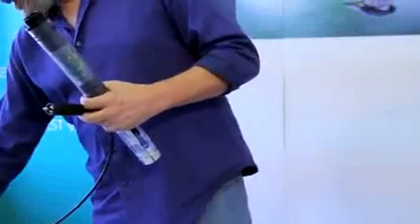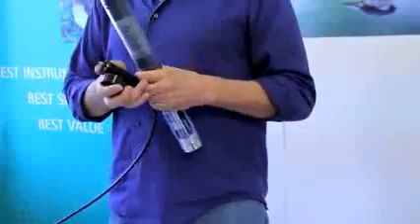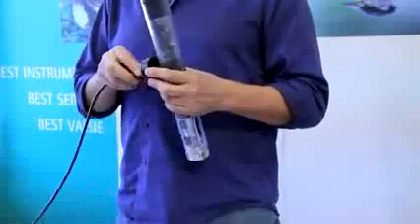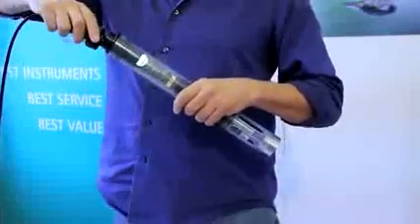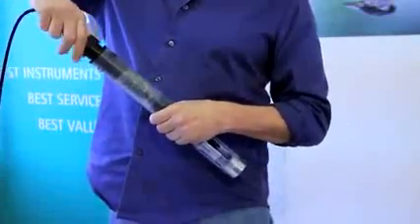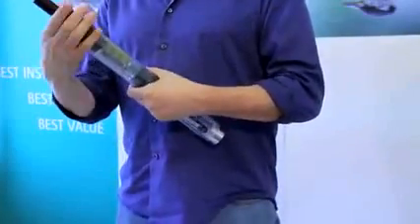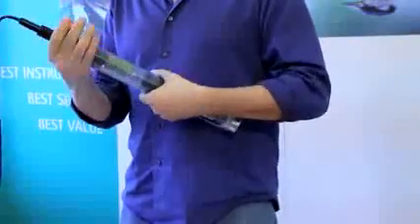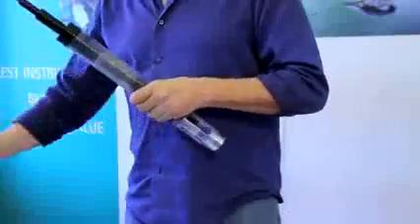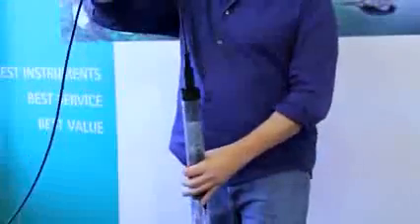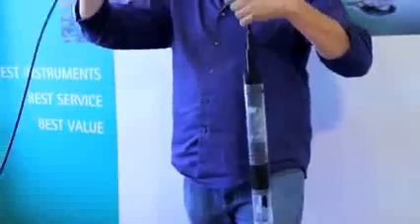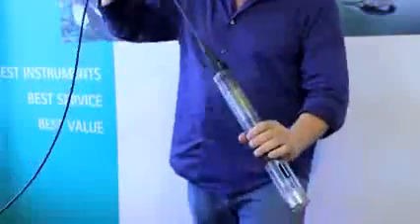Grab the cable. I will be using the same piece that holds the plug in to screw down the cable. So let the threads pull the cable down. So this has some strength built into it. We have strain relief in there. So you can use this to support the weight of your sonde.